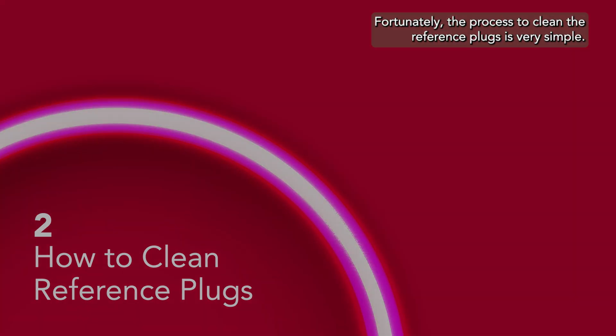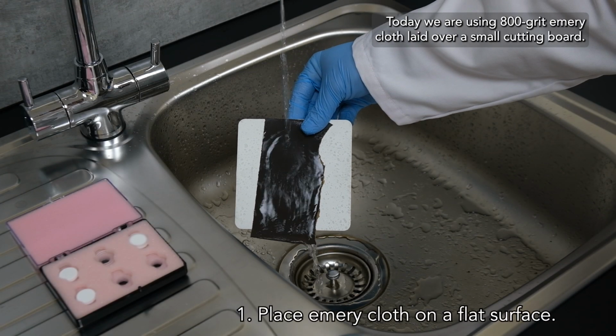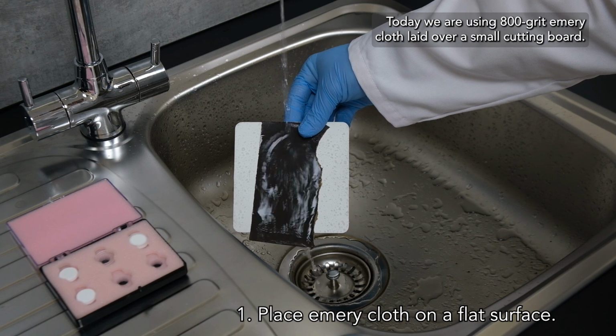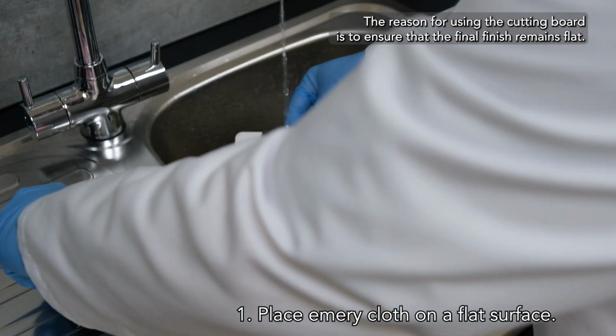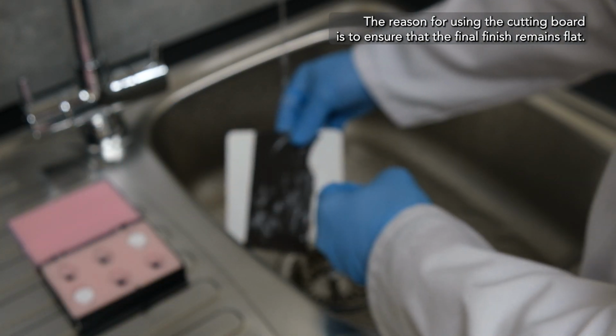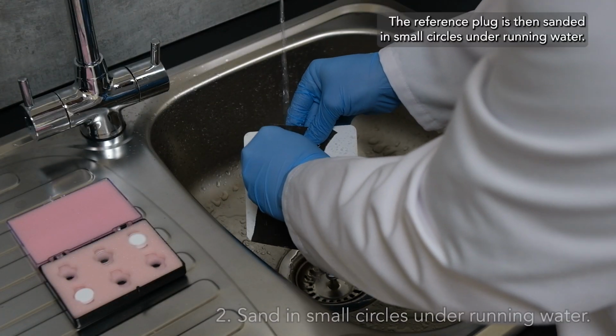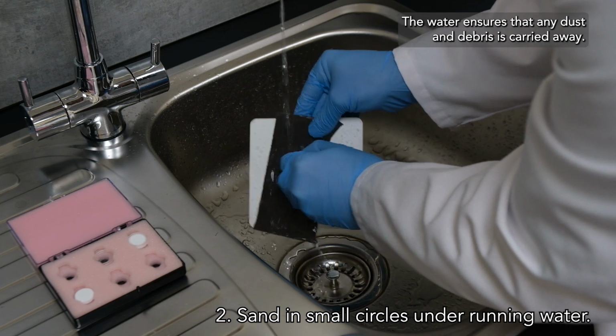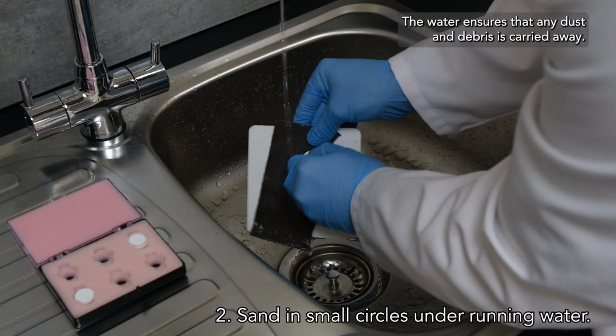Fortunately, the process to clean the reference plugs is very simple. Today, we are using 800 grit emery cloth laid over a small cutting board. The reason for using the cutting board is to ensure that the final finish remains flat. The reference plug is then sanded in small circles under running water. The water ensures that any dust and debris is carried away.